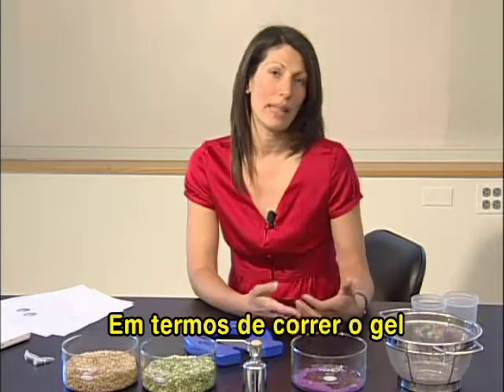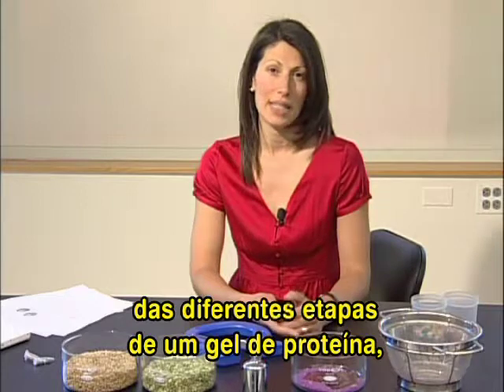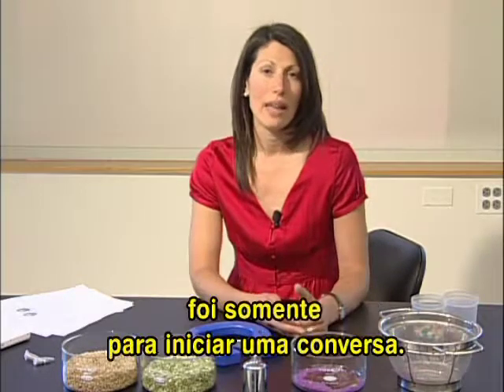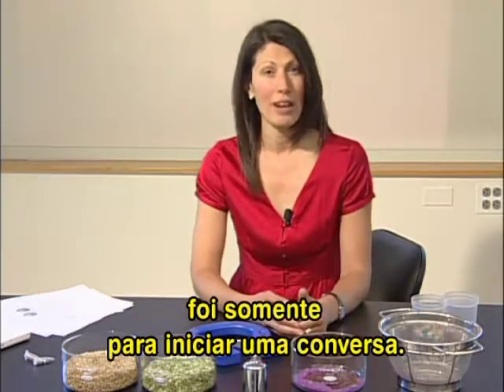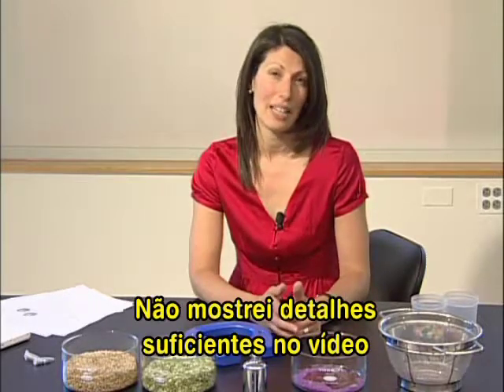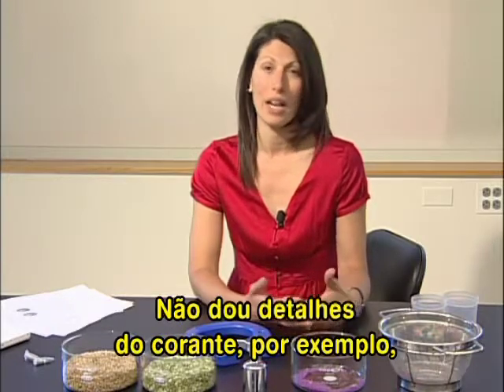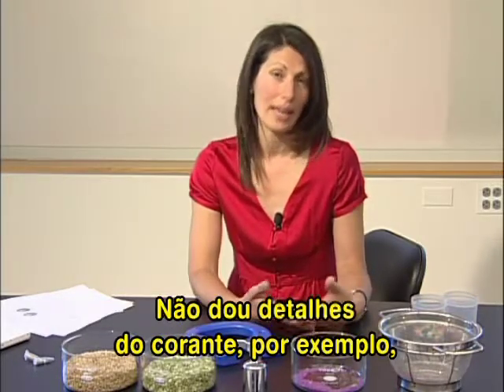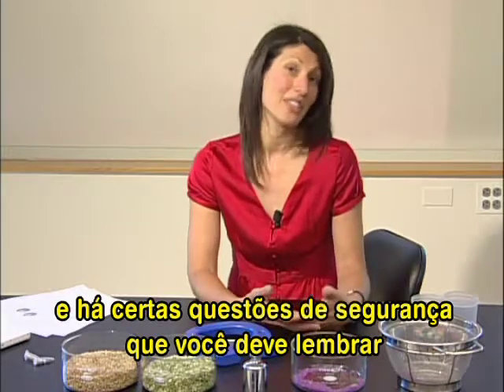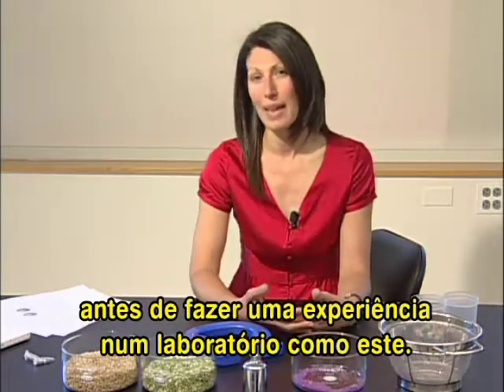In terms of running the gel and the very quick demonstration of the different stages of running a protein gel, that really was intended just to start a conversation. There is no way that I've shown you enough detail within the video for you to actually run a gel in the fashion that I've shown. I don't give the contents, for example, of the loading dye. And there are certain safety issues that you might want to consider before you actually run the lab if you run a lab similar to this.